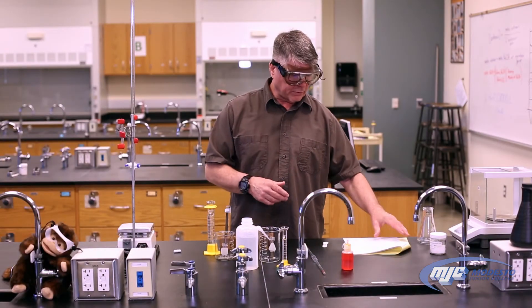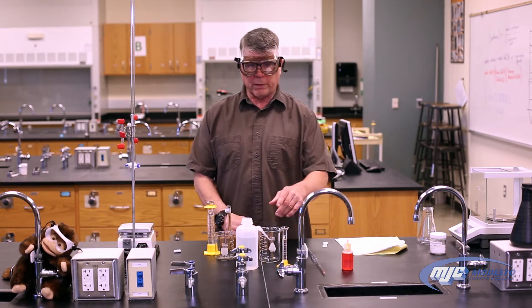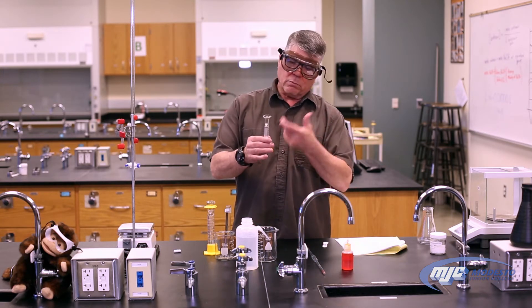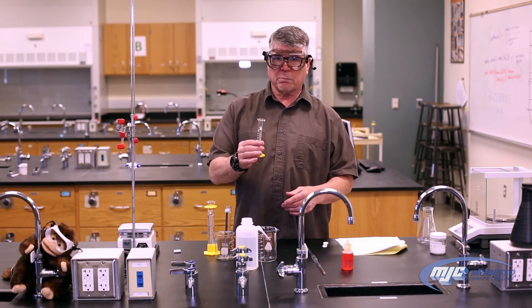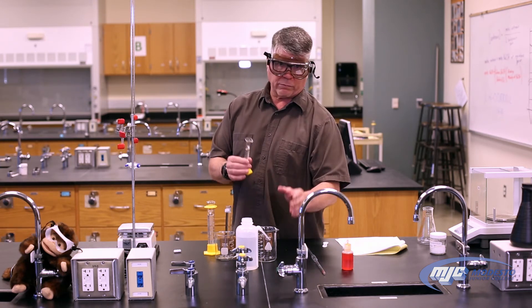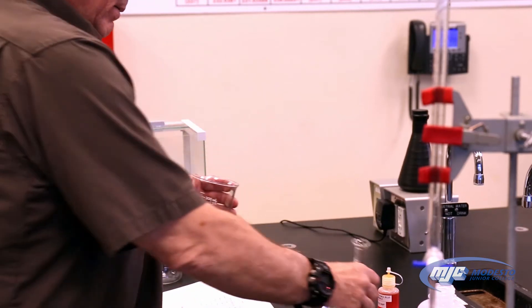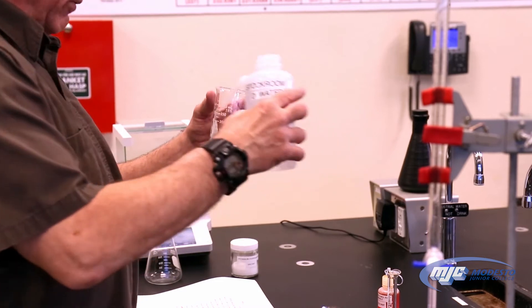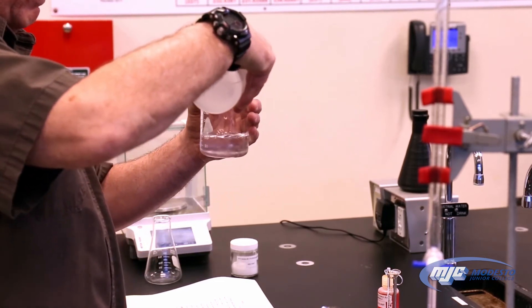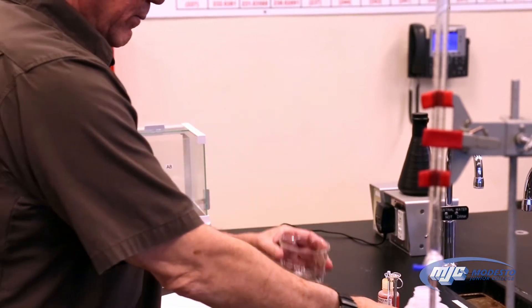This is Part A of the acid-base titrations experiment. The first thing we need to do is prepare our stock solution of sodium hydroxide. I have a little more than 10 mL of 6 molar sodium hydroxide. We're not measuring anything carefully here — it doesn't matter. So I add this to my 400 mL beaker and add roughly 200 mL of deionized water using the marks on the beaker. There's my stock solution.